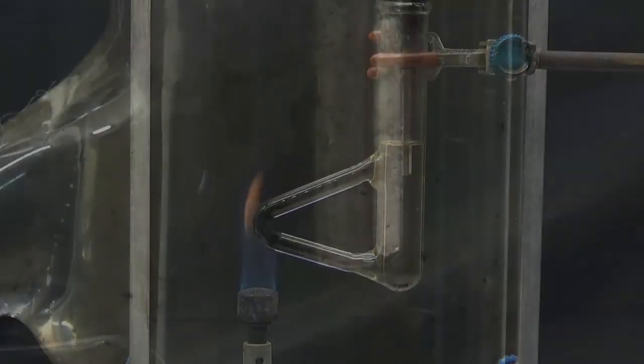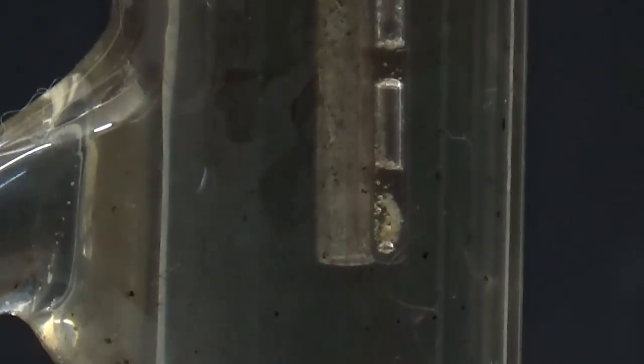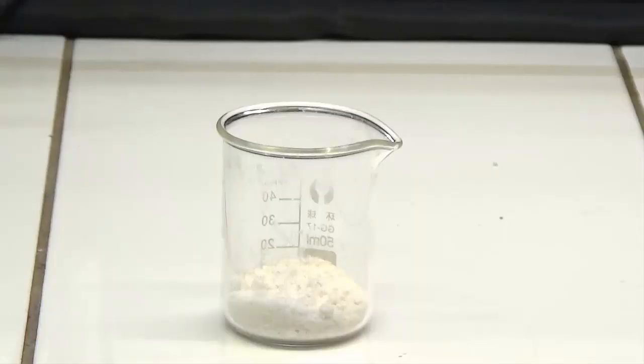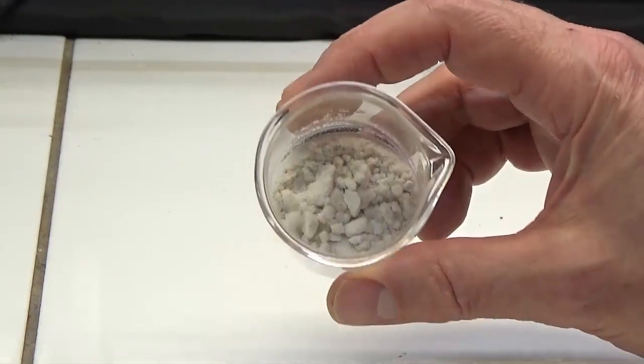Determination of the melting point: the theoretical melting point of phenacetin is 136 degrees and that obtained was 135 degrees. The product is pure and requires no purification.